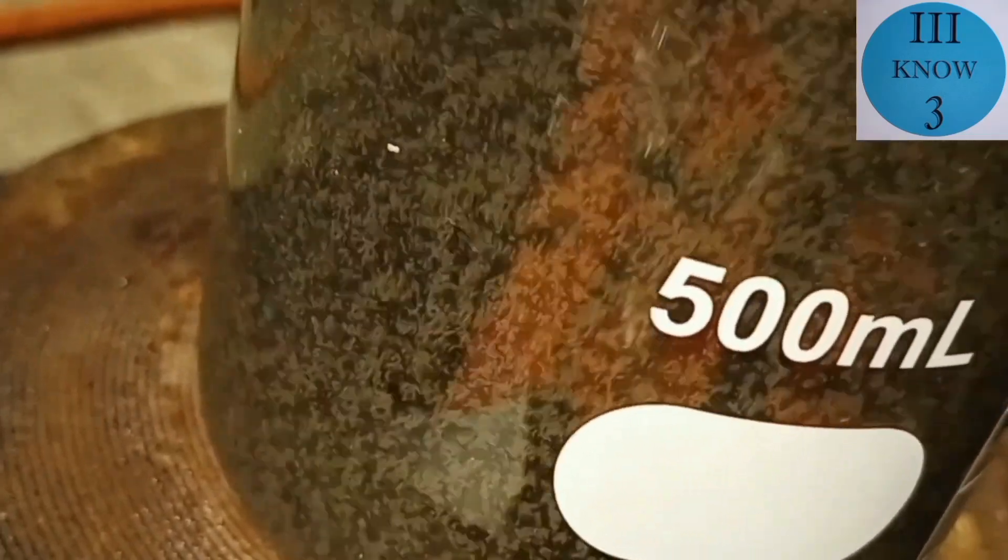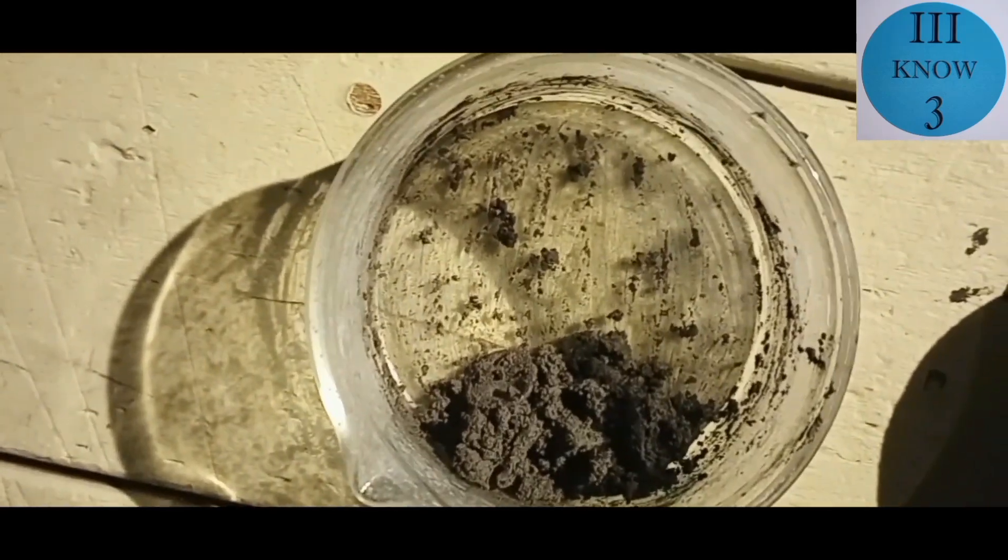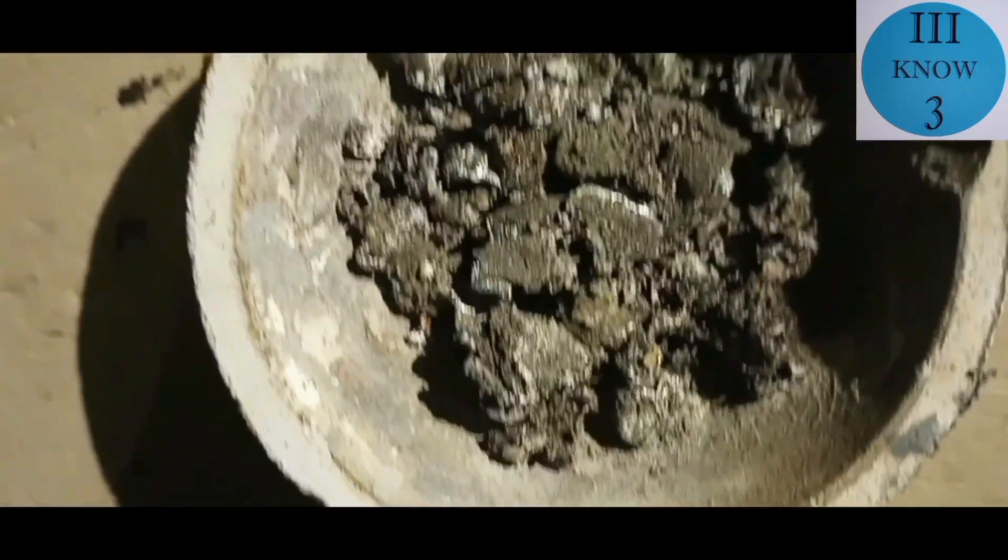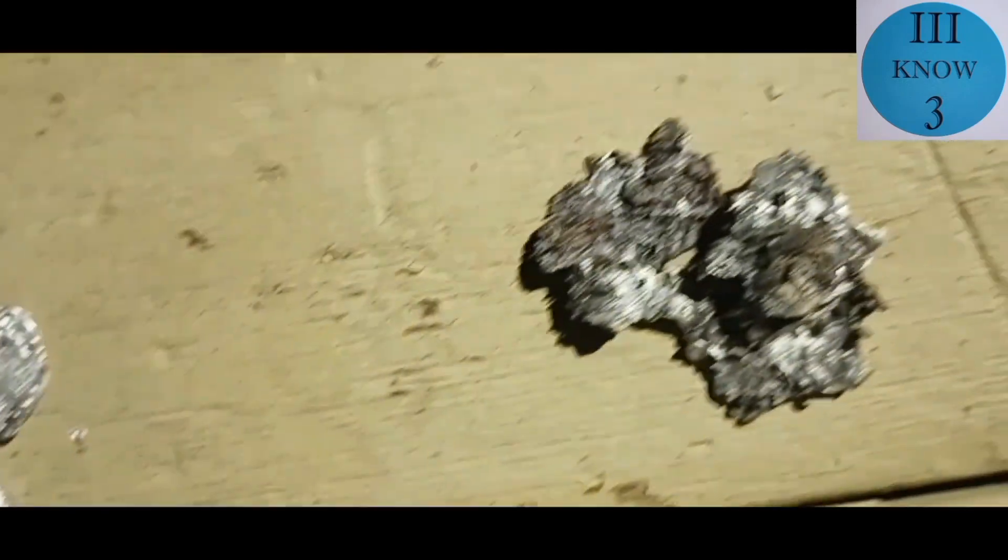Believe it or not, all of that when it was dried out turned into this. And there's some pure zinc there. There's some zinc with some nickel plating and there's some zinc with a lot of nickel plating.